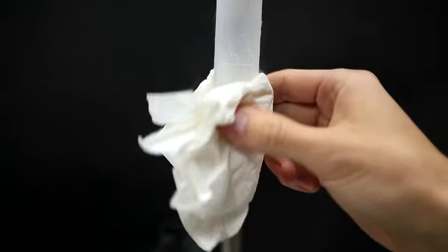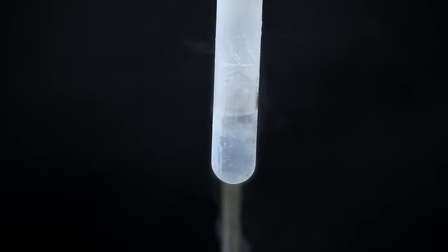Using a paper towel I wipe off the ice and you can see the nice pale blue color of the liquid oxygen.